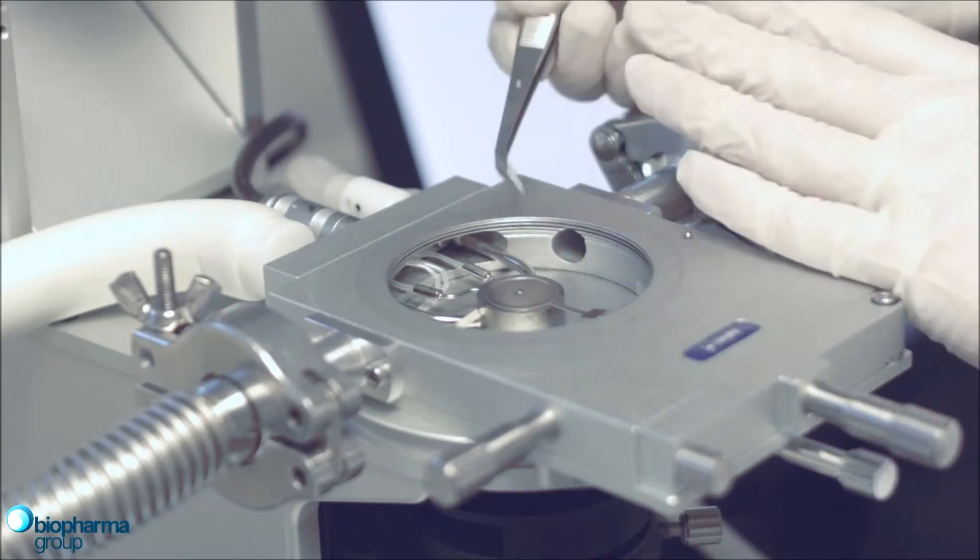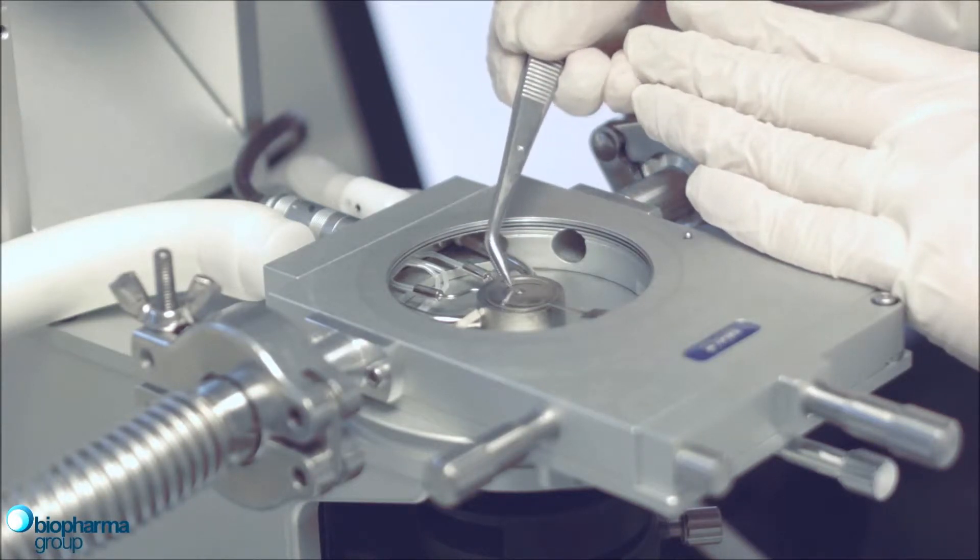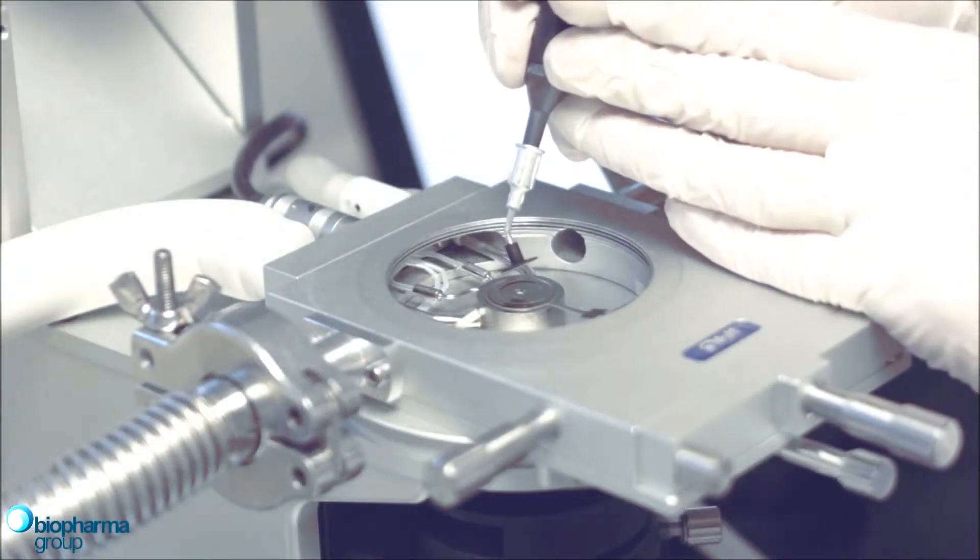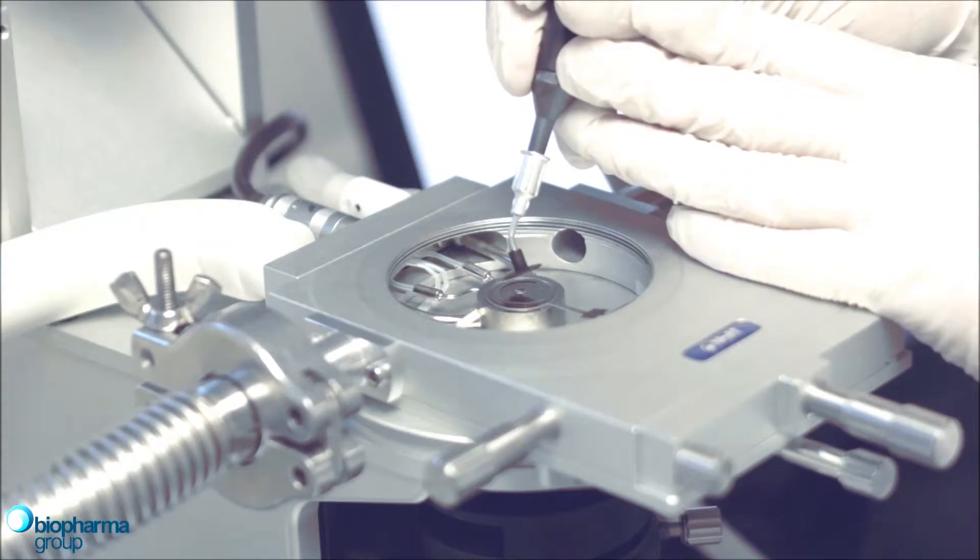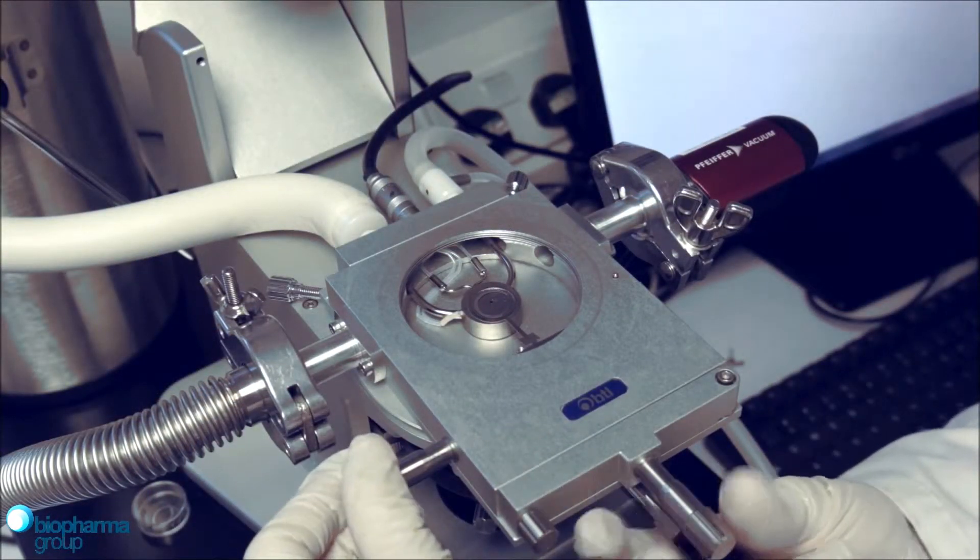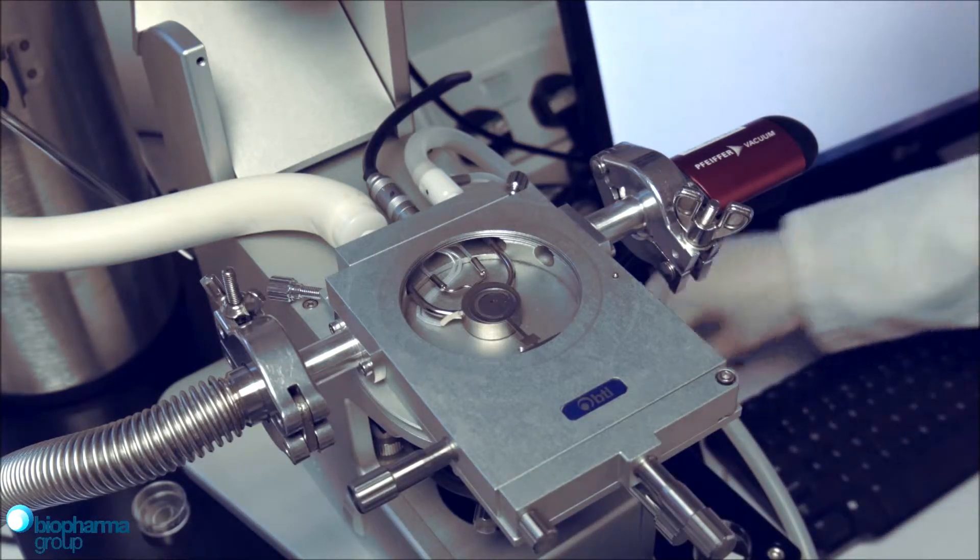Around this we place the 70 micron thick aluminum spacer, and this is then sealed with a glass cover slip which goes on. The sample should not be in contact with the spacer or the edge of the cover slip, or it is likely to spread around as a result of the surface tension, and that again will affect the thickness uniformity.